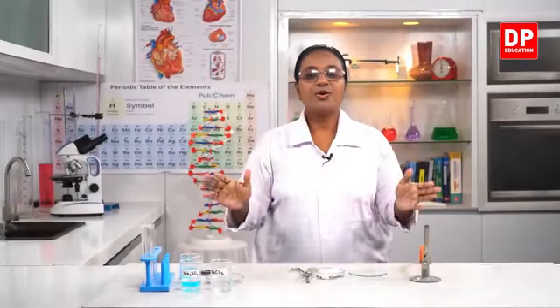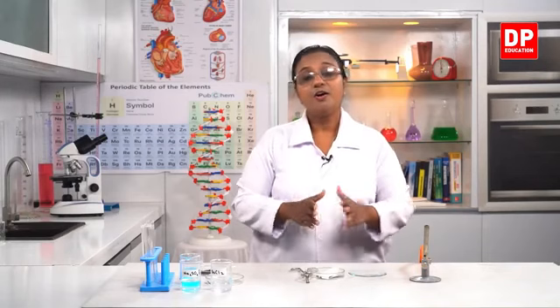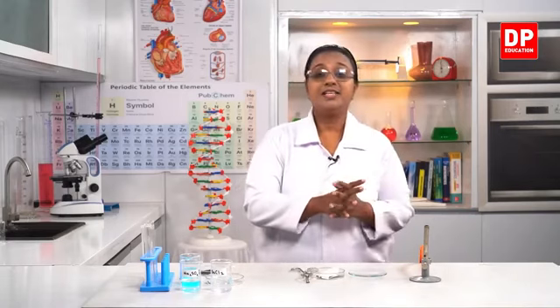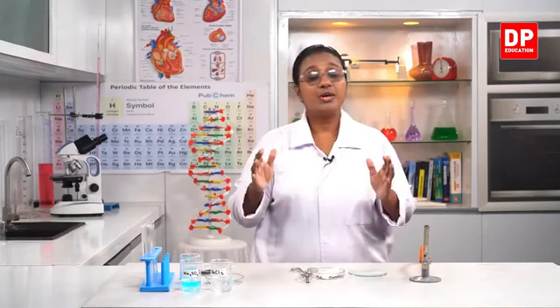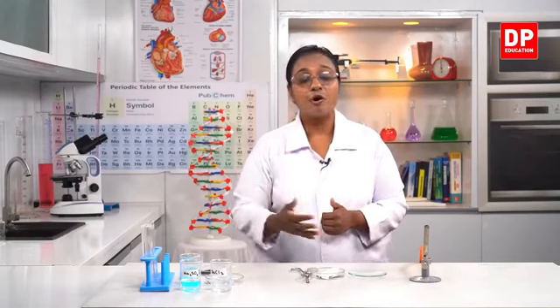Okay students, so now we are going to observe different types of chemical changes. You already know what chemical changes are. What are they? Formation of new substances from existing substances. So there is the rearrangement of constituent particles taking place, or atoms rearrange from the existing state to the new state. So what are the existing substances called? They are known as the reactants, and the newly formed substances are the products. So in a chemical change, we have the reactants. They undergo chemical changes and form the products.